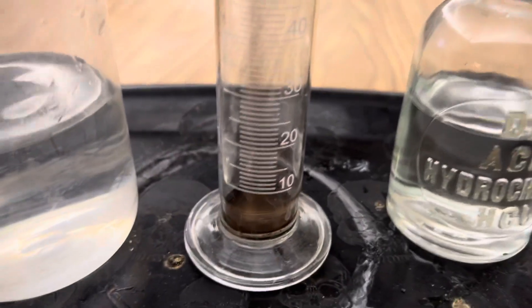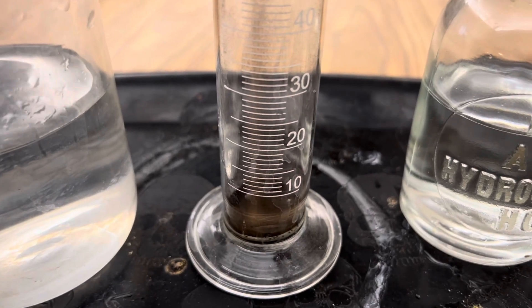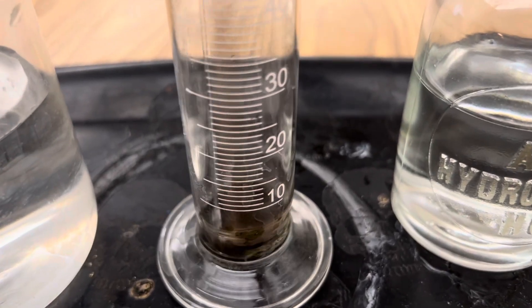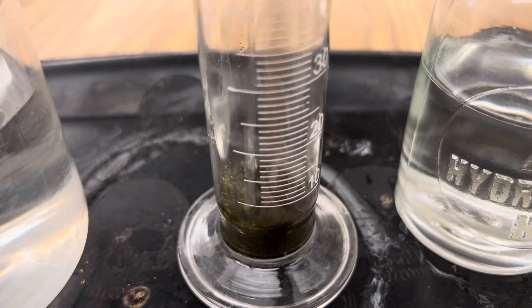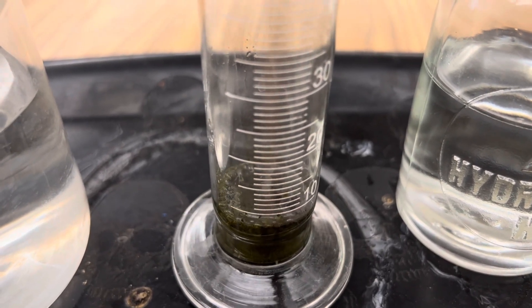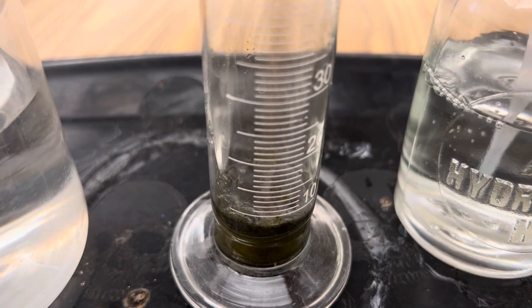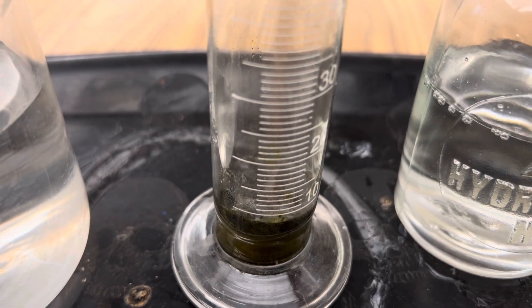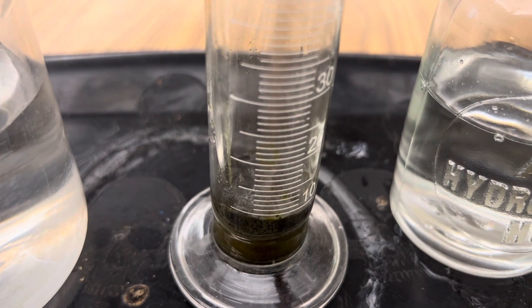This is a single displacement reaction because right away hydrogen is going to be displaced in the form of a gas. You should start seeing some bubbles. And the final product is going to be iron chloride.